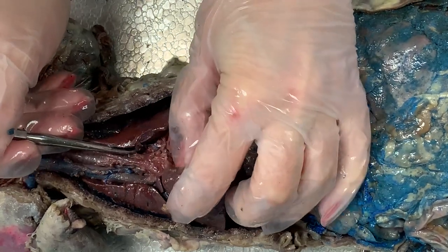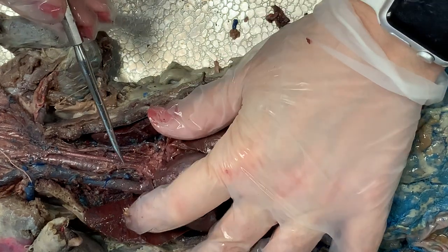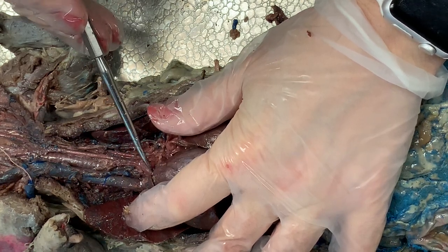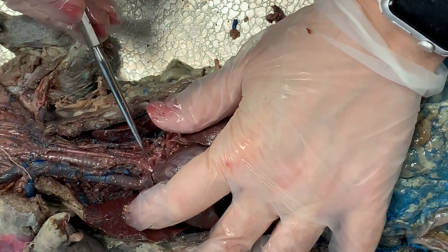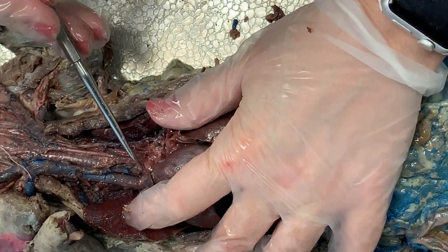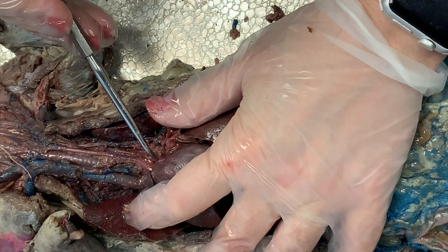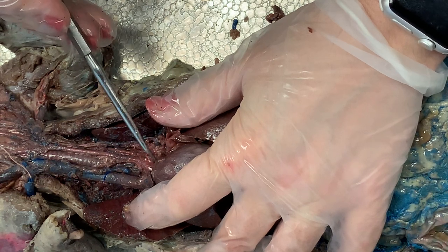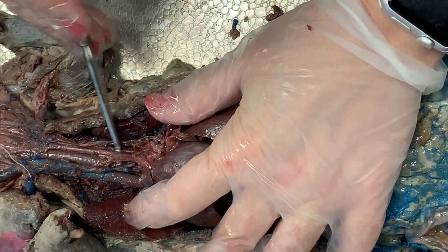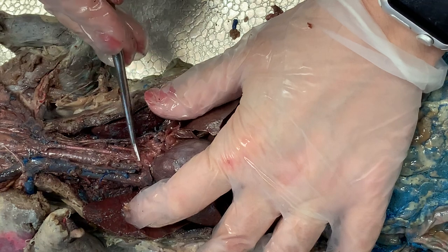We can also see the aorta. Pushing the heart down and holding the lungs back — this is the aorta right here. It's usually quite large and may feel squishy if your mink has adipose tissue, and it's thick with connective tissue. It's the vessel under the most pressure because it's carrying blood away from the left ventricle. The aorta sits just superior to the pulmonary trunk. One way to identify the aorta is to find two arteries coming off of it — here's one and here's another, so I know that has to be the aorta right there.